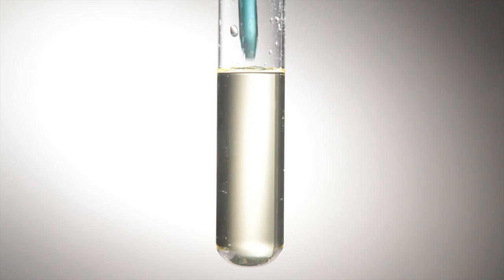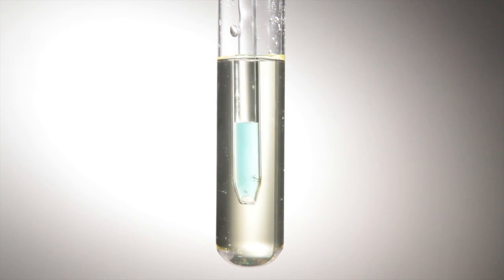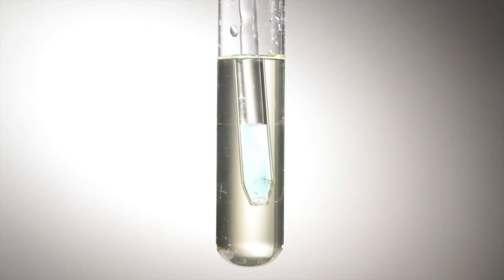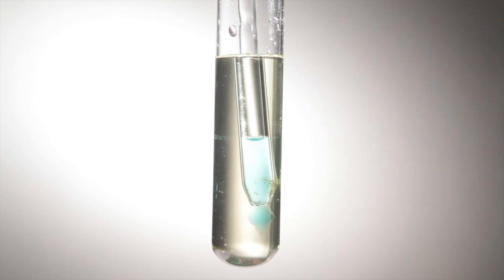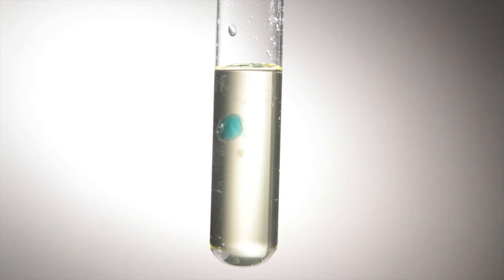This leaves me able to focus completely on delivering the droplets to near the base of the tube, about one to two centimeters from the bottom. You don't want your little cell to stick to the glass. I press the syringe closed and deliver a pea-sized bubble of blue liquid and immediately remove the pipette.